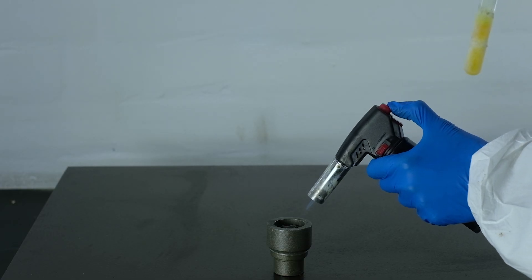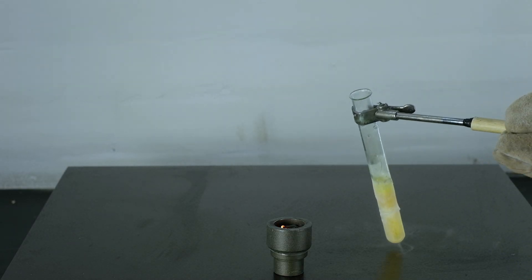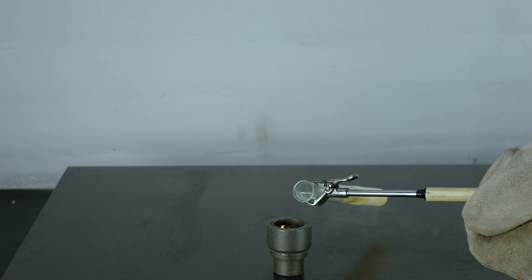When heated, titanium reacts with chlorine very actively, forming a huge amount of smoke that consists of titanium oxychlorides.